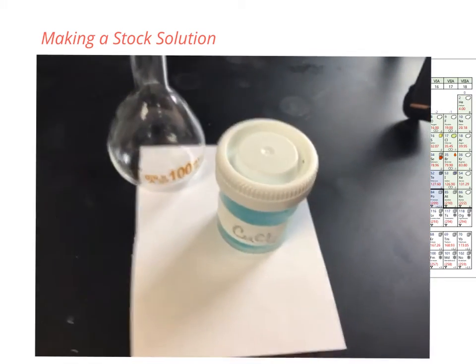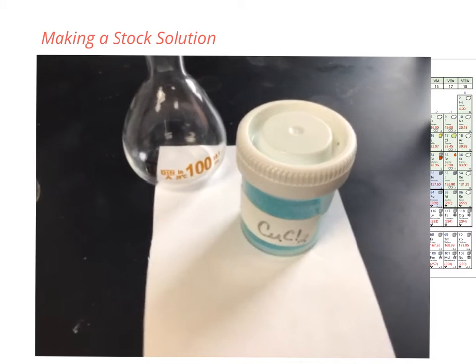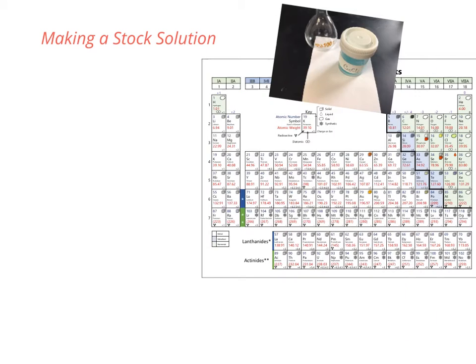So we'll have to first figure out how many moles we need. Now, the formula is CuCl2, copper 2 chloride. We want to end up with a solution that is 0.5 molar, or moles per liter. Therefore, we're going to have to figure out how many moles, x, divided by the number of liters, in this case 100 milliliters, or 0.100 liters.